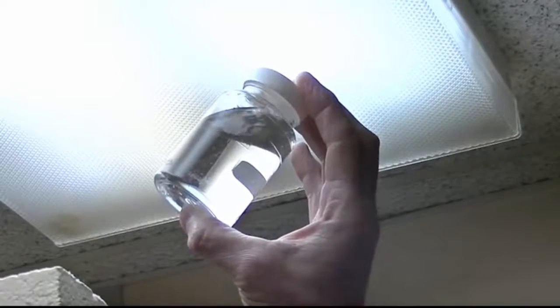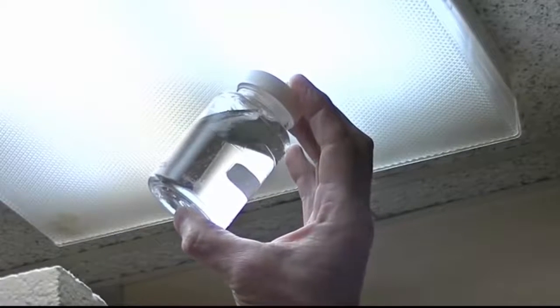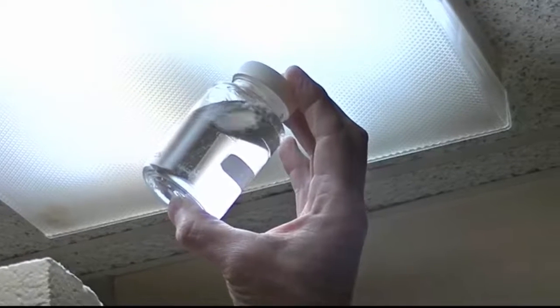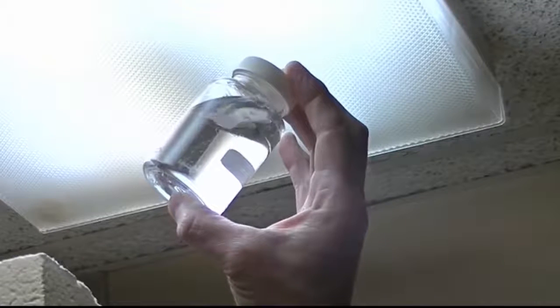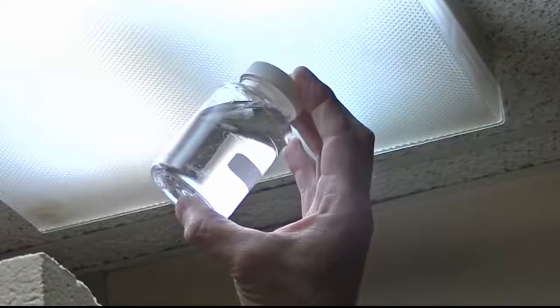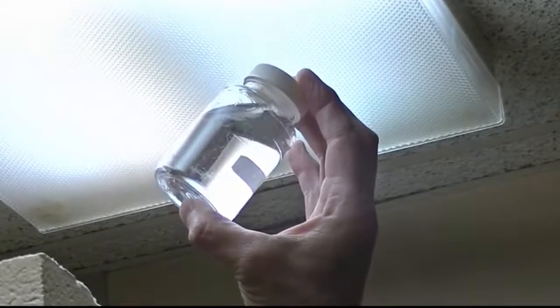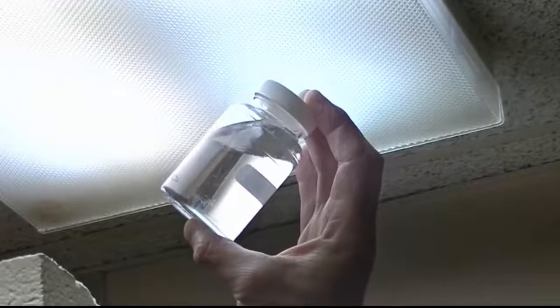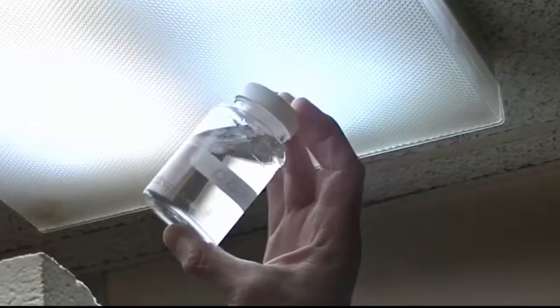This is the perfect time to do a visual inspection. Hold the bottle up to a light source and look at the water inside it. You should not be able to detect any particles in the water. If you can, dump out the water, get another sealed bottle, and collect a new sample. If there is anything visible in the water, it will be contaminated and not something you'll want to send to the lab for analysis.